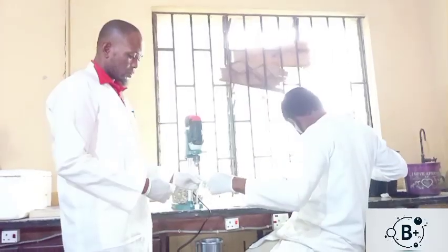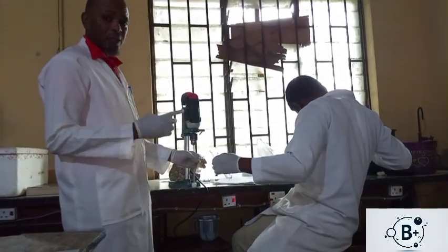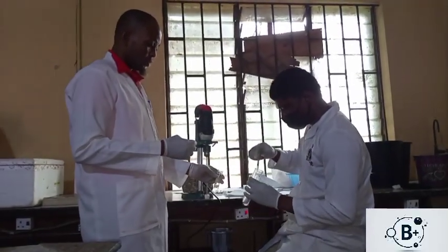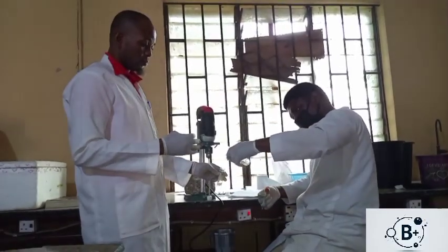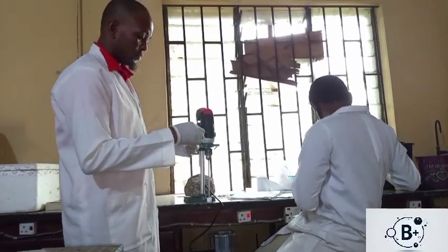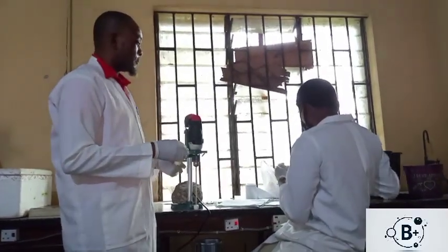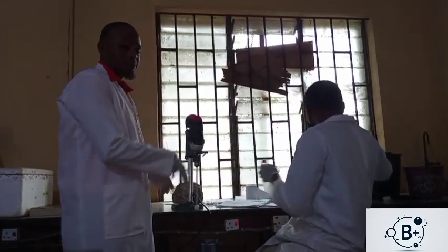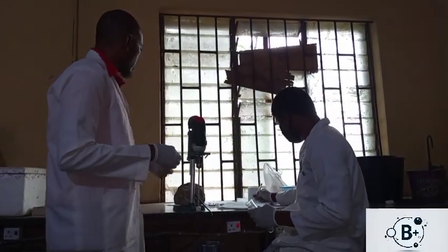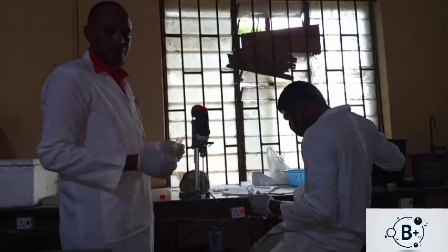I'll take out the contents. We are flushing with the remaining amount of the homogenizing buffer. So instead of adding all the buffer to it at the same time, you can add some and use the others to flush the content out of the tube. In so doing, you have a good extraction. So you have all the tissue content being homogenized in the homogenizing buffer. So that is the essence of it.